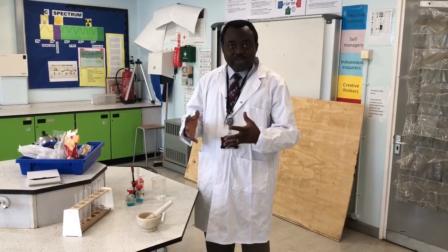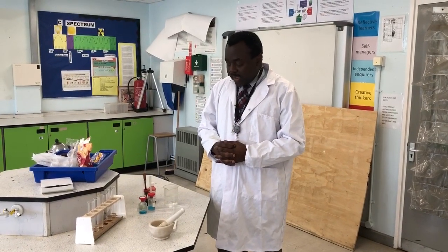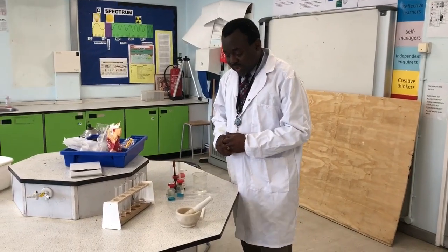I will be talking about food tests today. We'll run through the test for starch, the test for sugars, the test for protein, and the test for lipids. First of all, let's start with the test for starch.